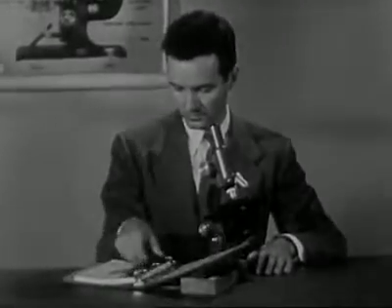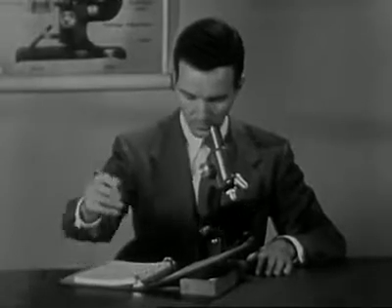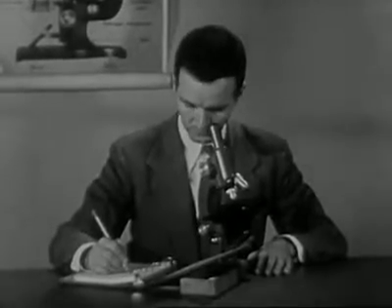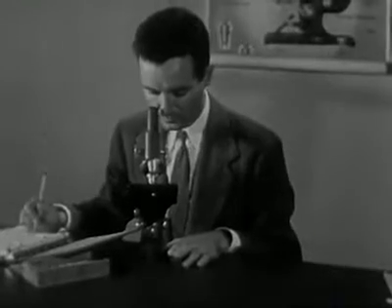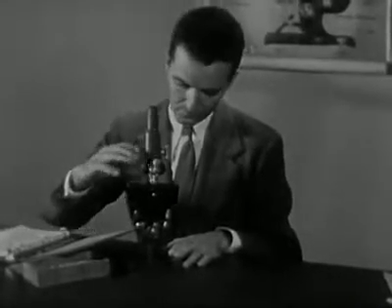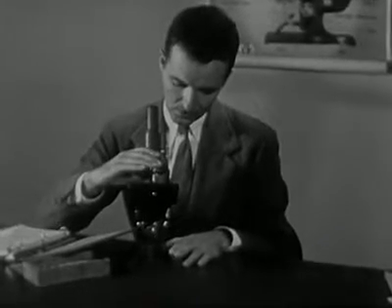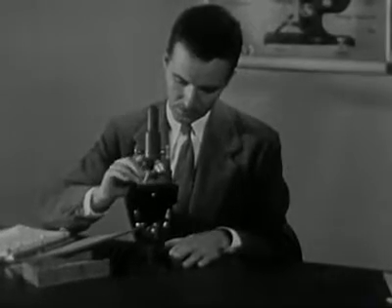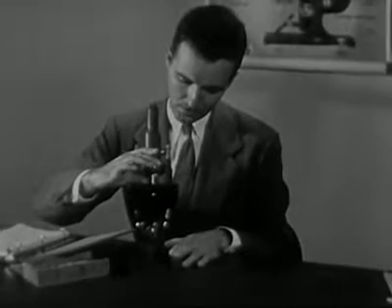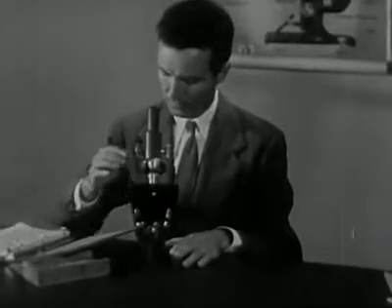Most of your studies of the small plants and animals will be done using the low-power objective, since the low power gives you a better overall view of most plant and animal structure. You will use the high-power objective in some of your studies of cell structure, however, and it is important to know how to use it correctly. First, turn the revolving nosepiece until the high-power objective snaps into place.